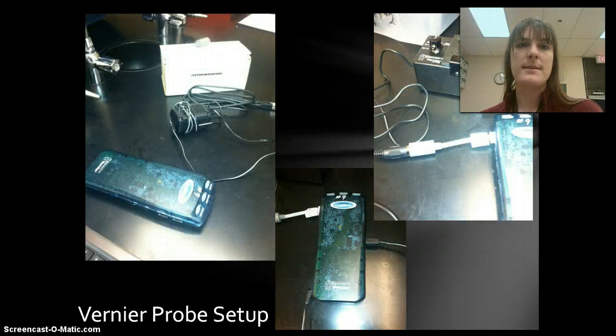Okay, so to set up this, we are going to use a system called Vernier. Vernier has a lot of different probes, and they interact with the computer in different ways. The one that we're going to use in this case is the colorimeter. To set up this probe, there's a bunch of stuff that we need. So you need this little green box. This is the little communicator. It's going to help communicate with the computer. We've got here a power source, we've got a USB cable, we've got our probe, in this case, the colorimeter.